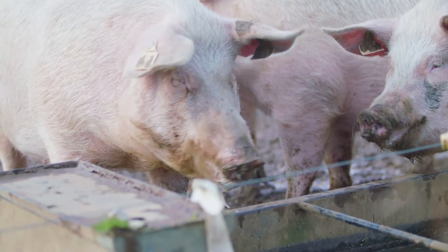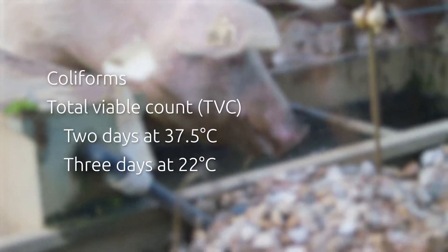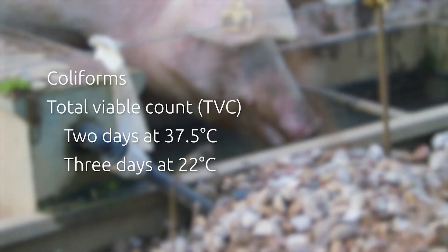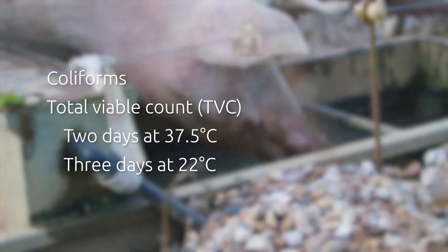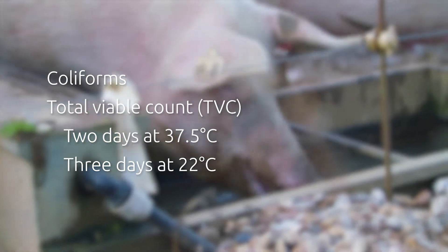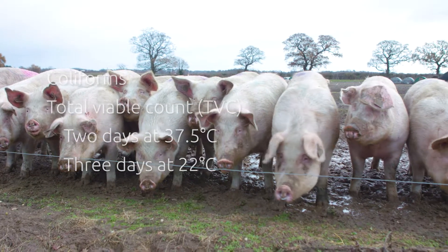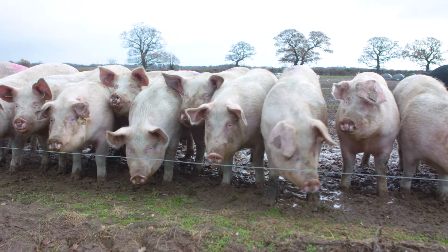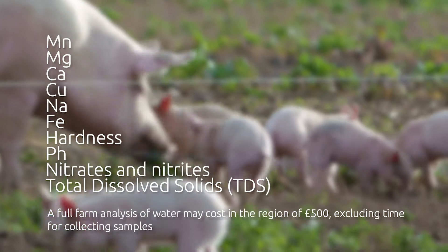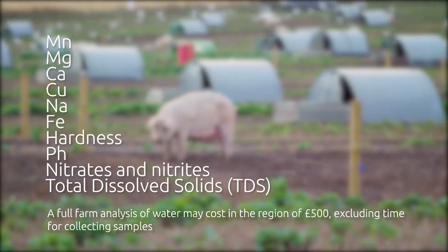Analysis should be carried out for Coliforms, Total Viable Count: 2 days at 37.5 degrees and 3 days at 22 degrees. If you are also testing for mineral analysis, the standard AHDB panel includes the minerals shown on the screen now.